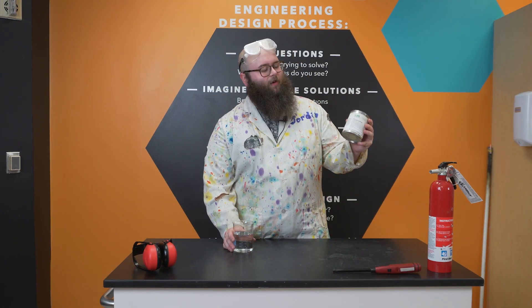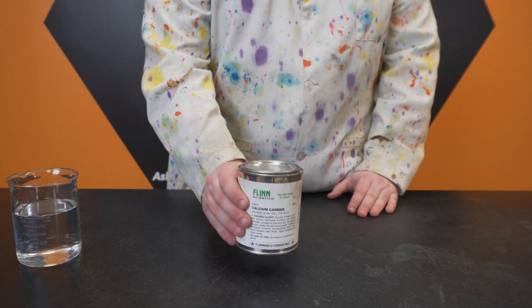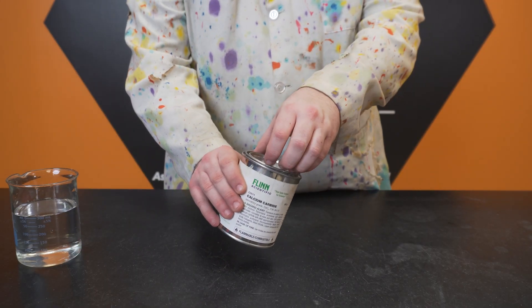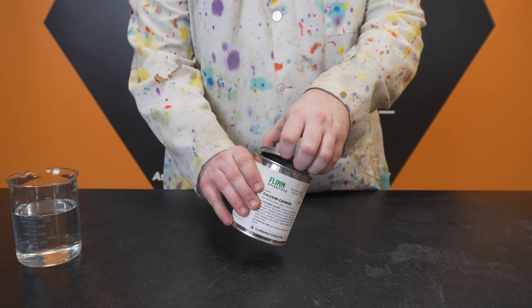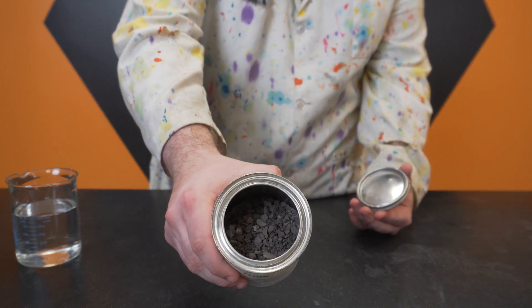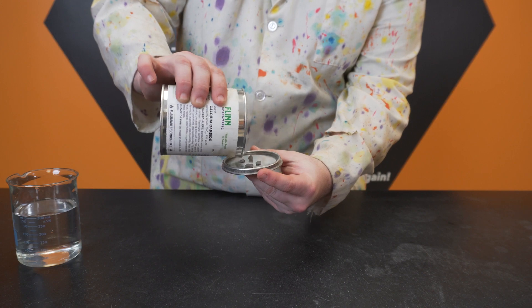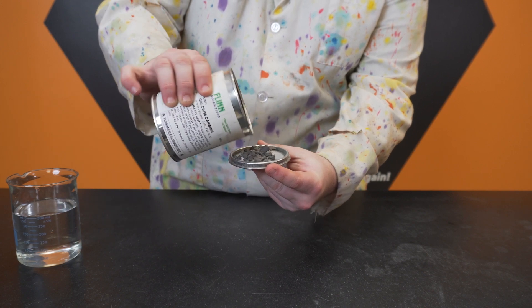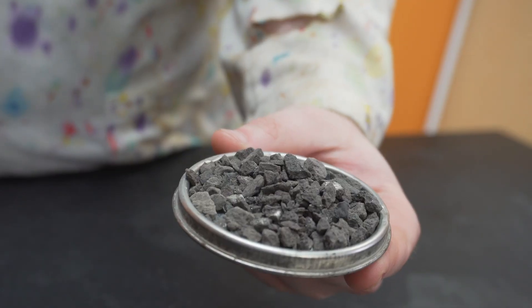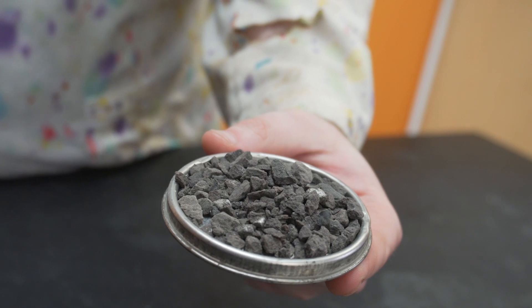Let's begin by taking a close look at our reactants: calcium carbide and water. Calcium carbide is a solid substance produced in an electric arc furnace at extremely high temperatures. Calcium carbide has many uses in industry, such as the desulfurization of iron and producing light in old miners' lanterns.